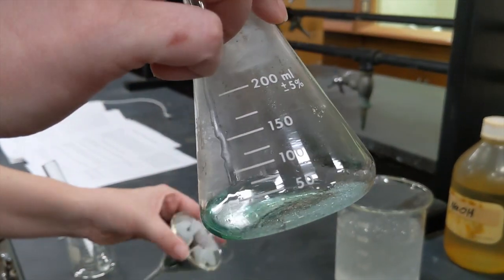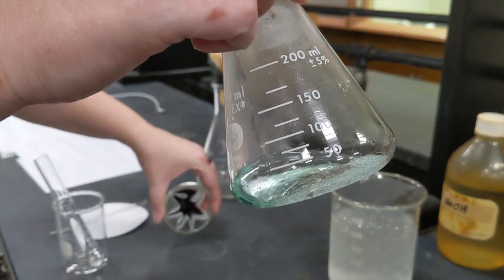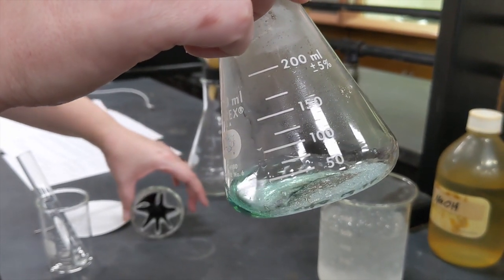And if you see down here in the bottom, we can see some crystals. That is our iron sulfate. But we'd really like to make more than that.